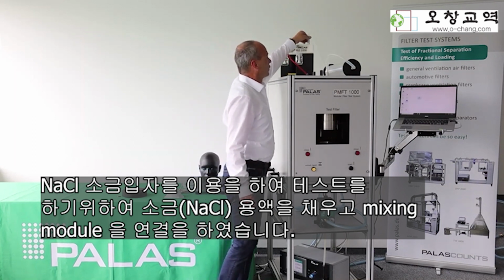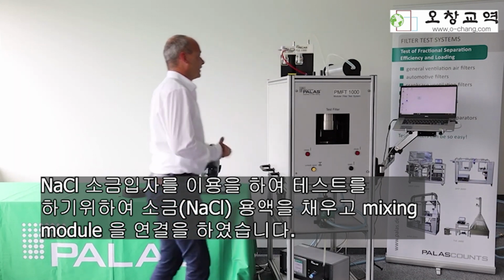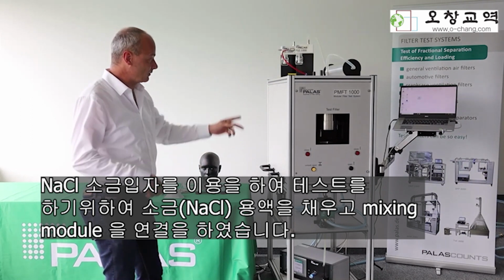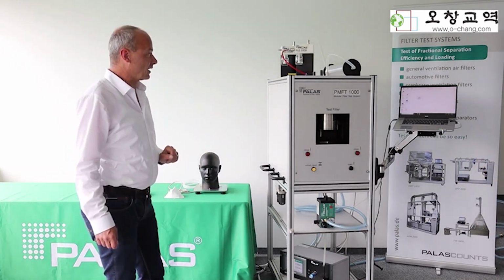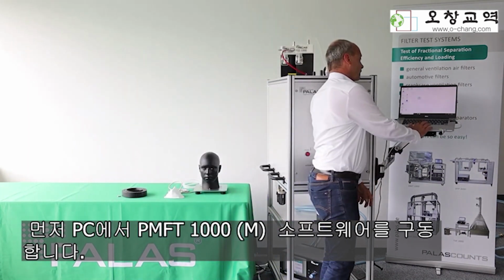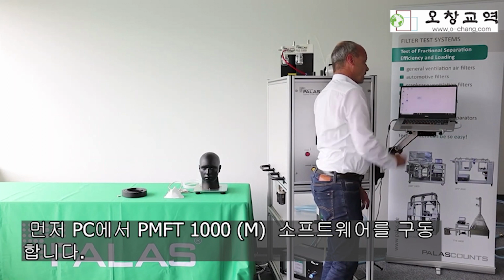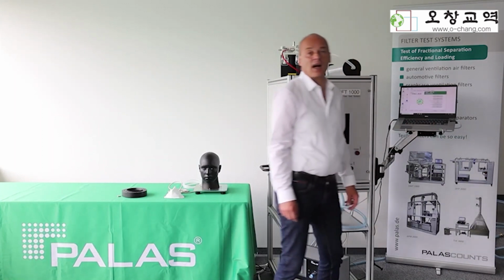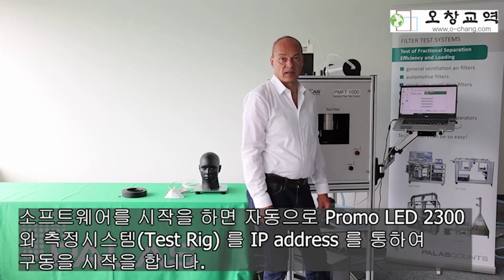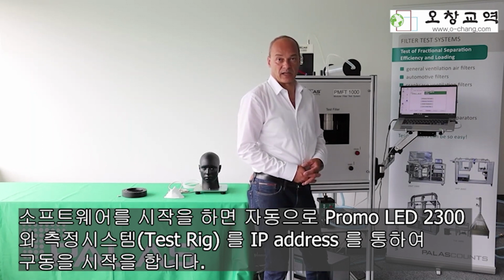We start first with the setup for the sodium chloride test, including the mixing chamber in front of the inlet to the test cabin over here. And what we did not do up to now is starting the software at the computer. PMFT 1000M software is started. It connects automatically via an internal IP address to the aerosol spectrometer, and the test rig is starting as well automatically.